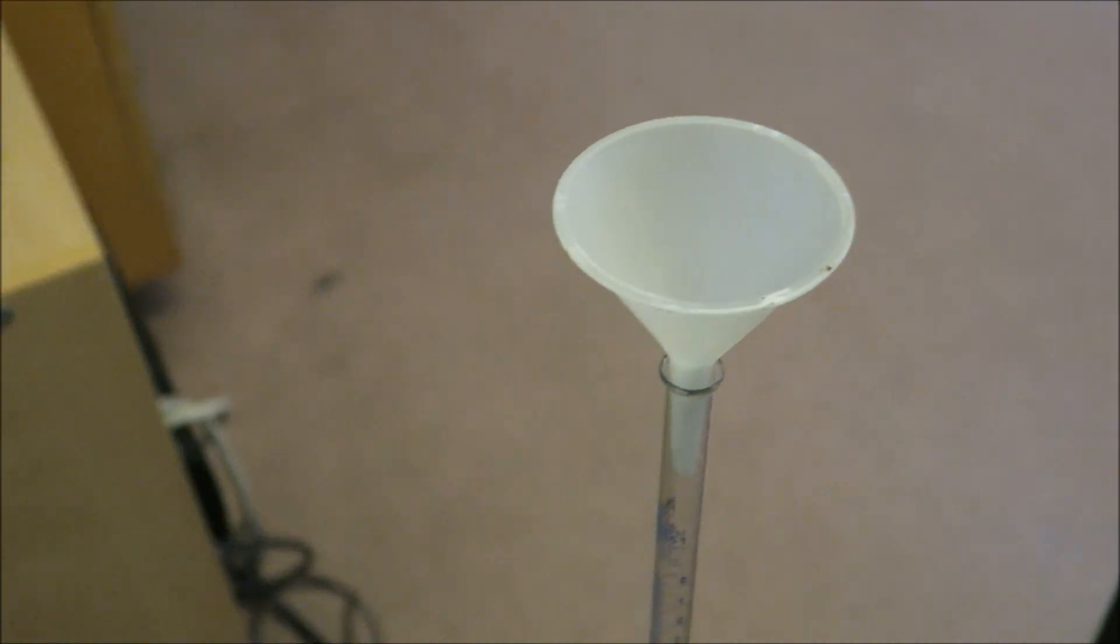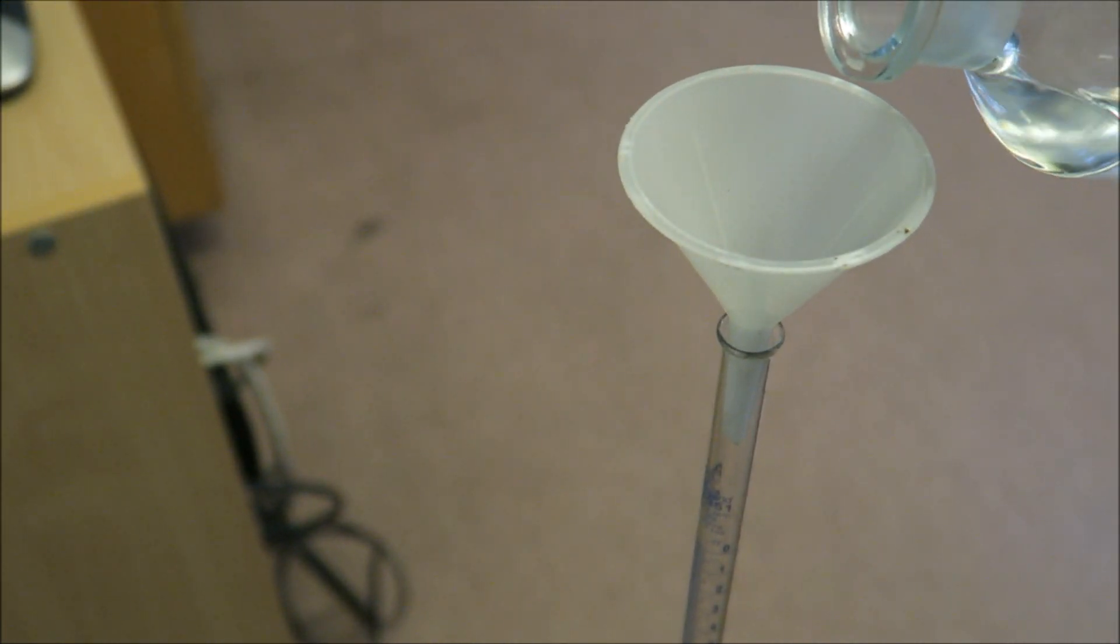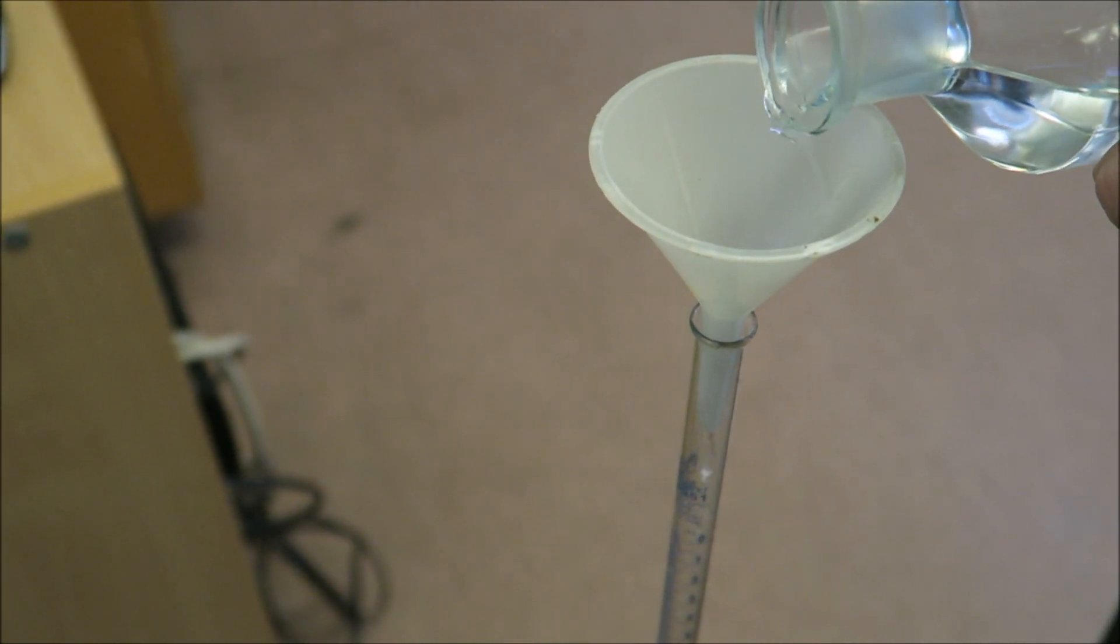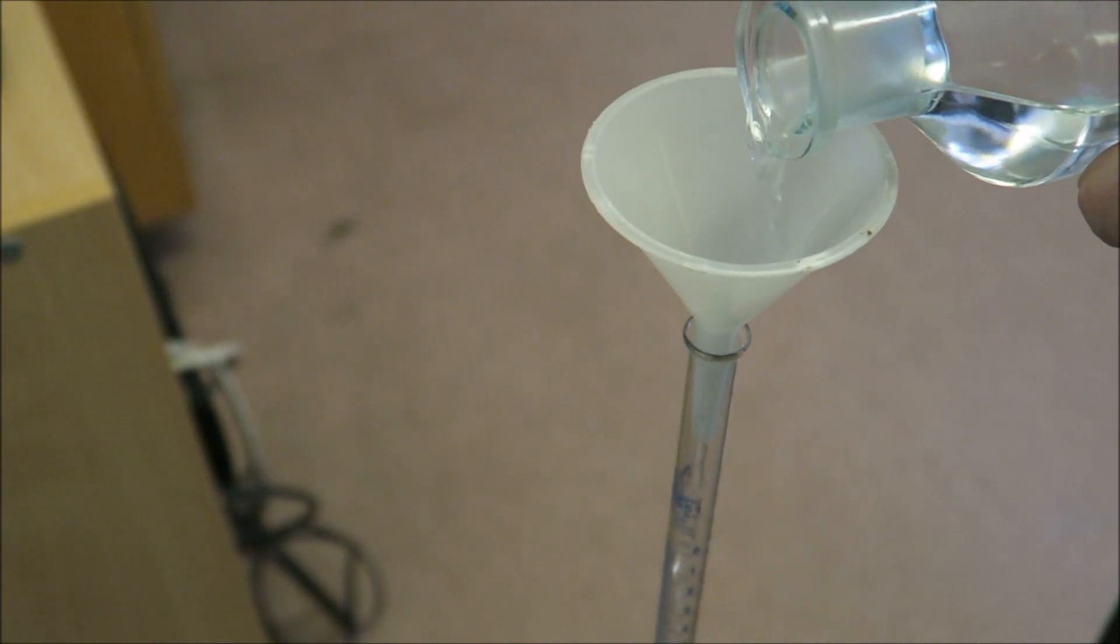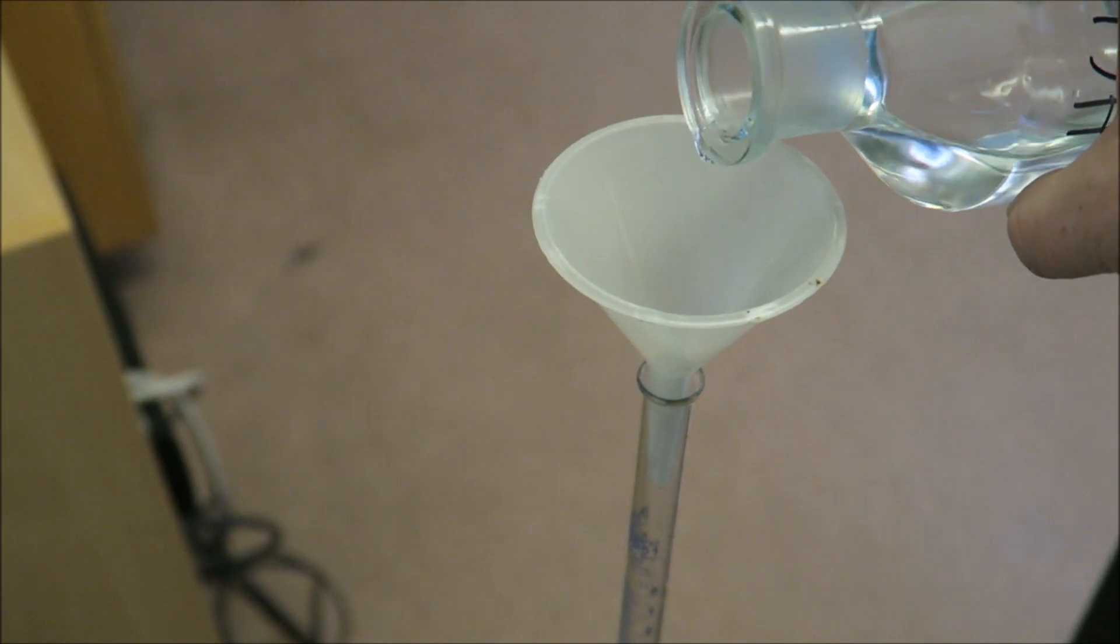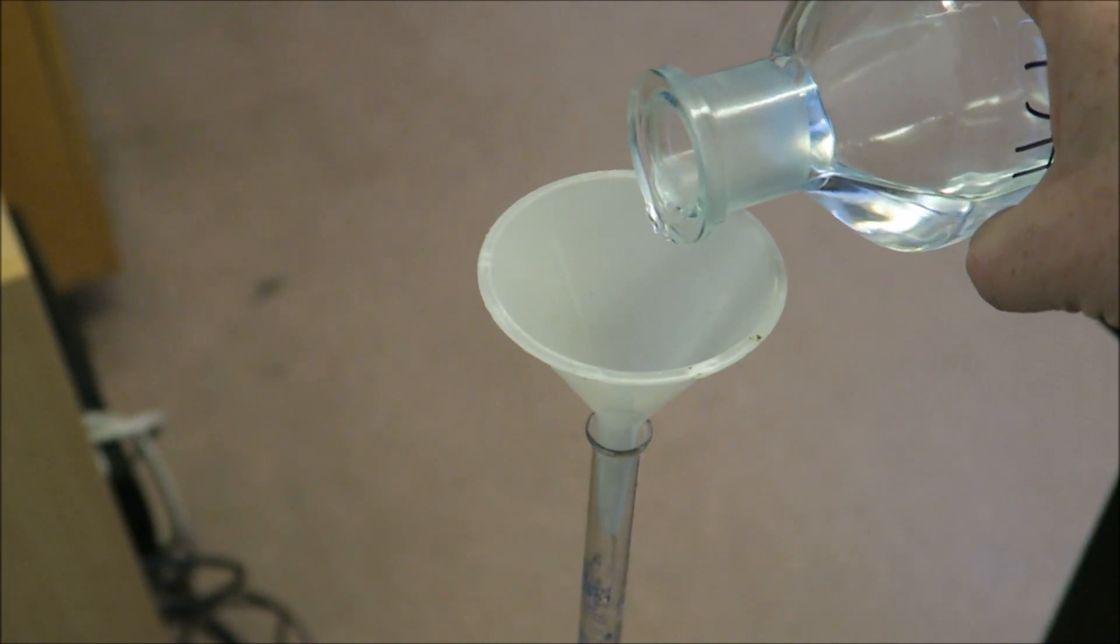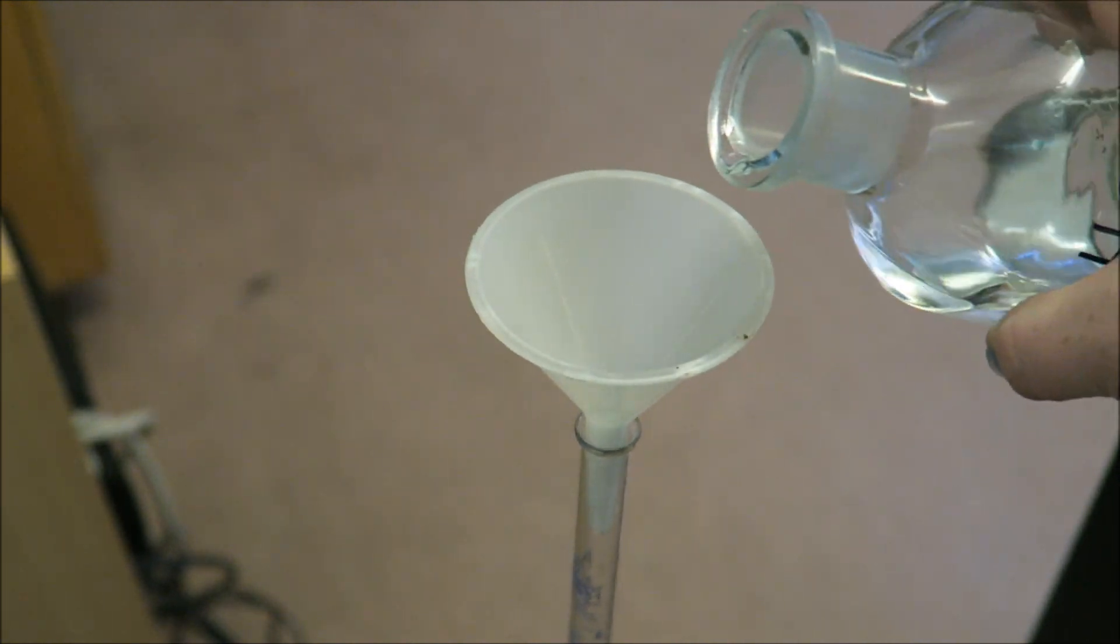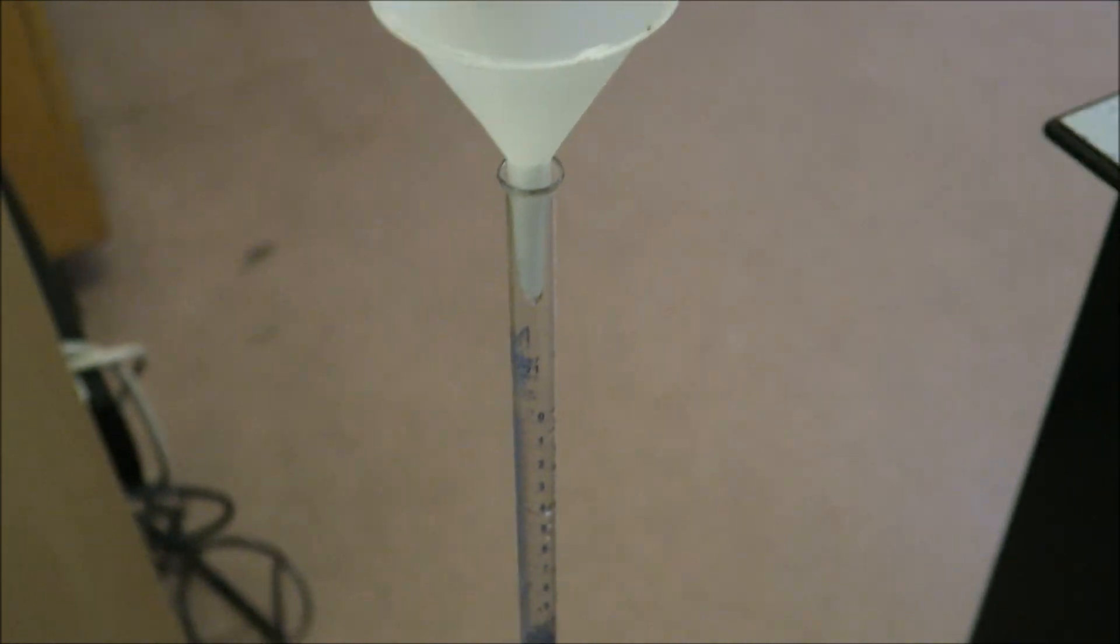Into my burette, I'm pouring some hydrochloric acid. You may be using sulfuric acid or a different type of acid—that's absolutely fine. I'm just using hydrochloric acid for simplicity's sake today. And you can see that I filled it.